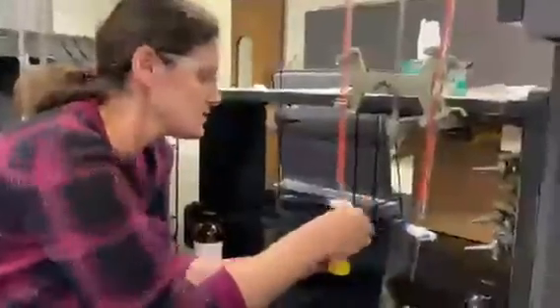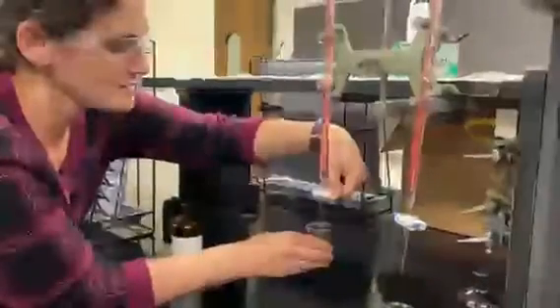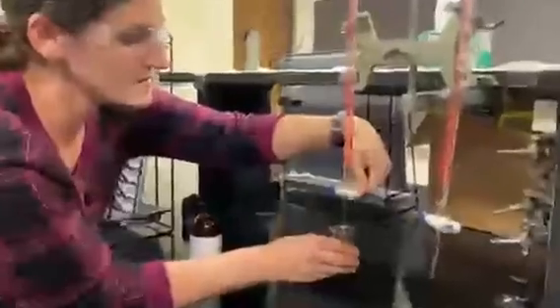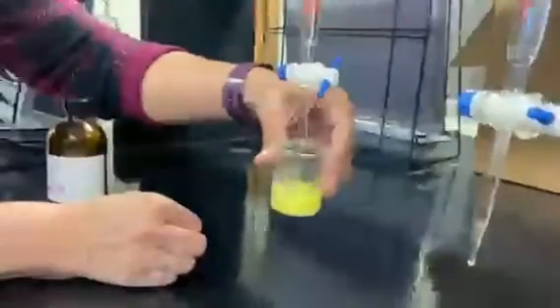That was faster than I wanted, but that's okay. Didn't start turning yet. I've got to get a better handle. Come on, drop-wise. No, not squirt-wise, I said drop-wise. There we go. Add it drop-wise. Try not to splash.